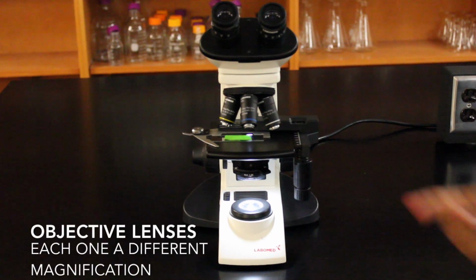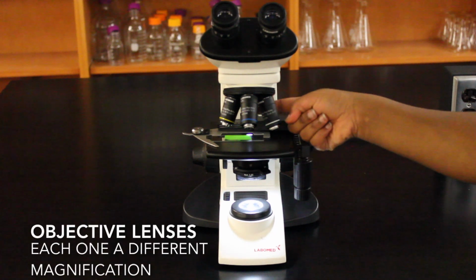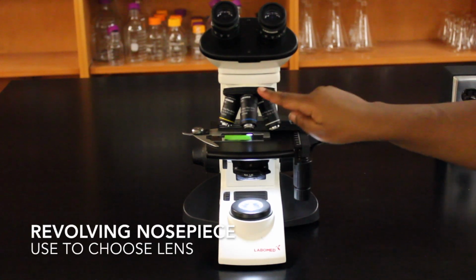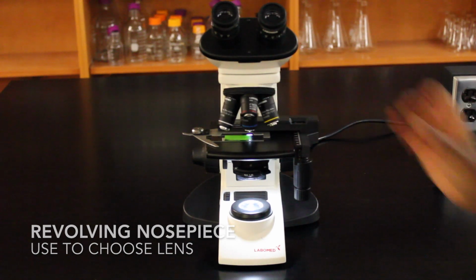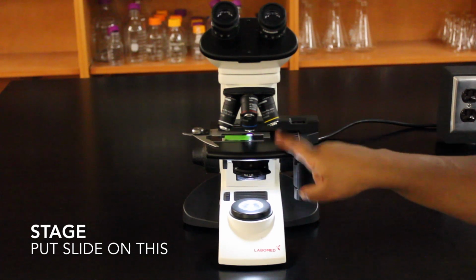The objective lens is what goes over the slide, and each one of these objectives has a different magnification. And to choose which objective is over the slide, you'll use the revolving nose piece, which rotates the objectives around. The stage is what you will put the slide on.